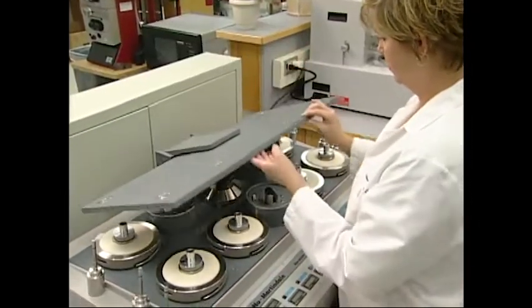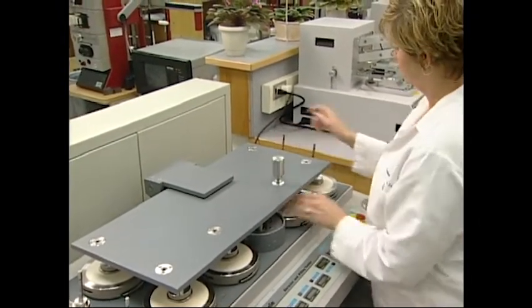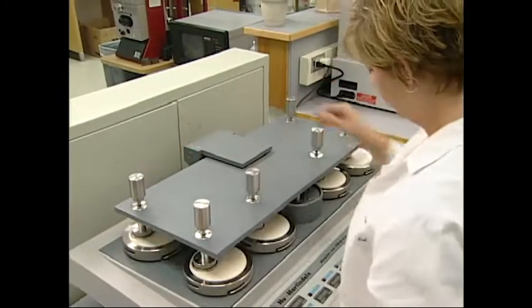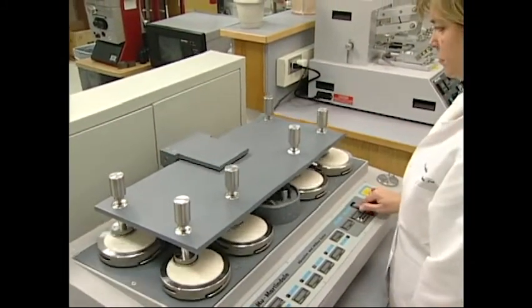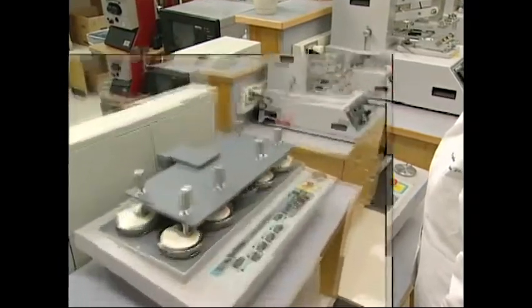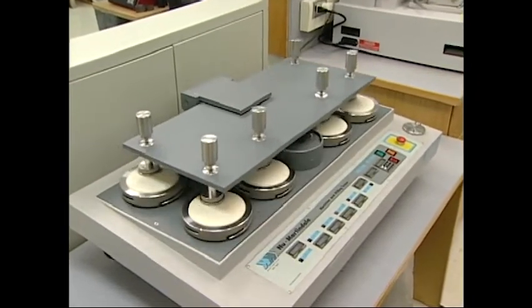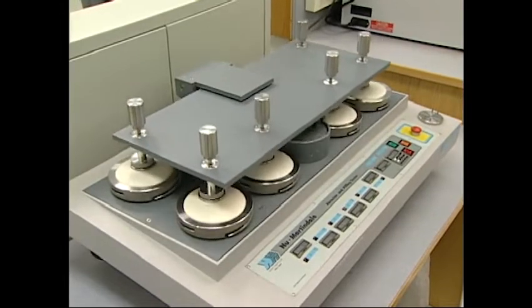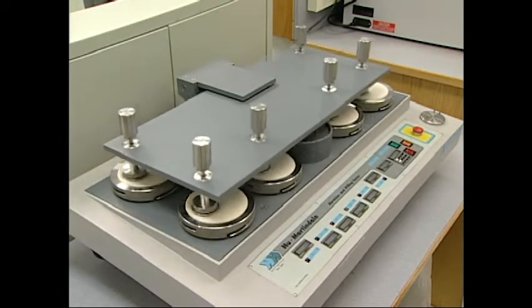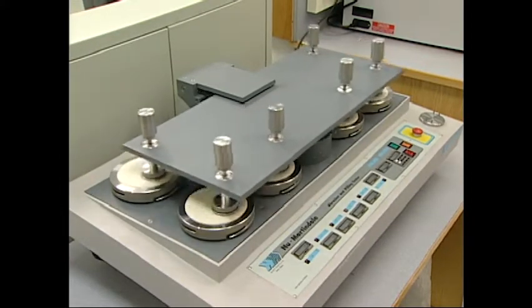The top of the tester is then lowered and the spindle is guided through the top plate. Once all specimens are loaded, the tester is started. Abrasion resistance using the Martindale tester is measured by subjecting the flat specimen to a rubbing motion. The direction of the abrasion is in the form of a geometric figure that begins as a straight line, which gradually becomes a widening ellipse, which eventually forms another straight line in the opposite direction and then traces the same figure again. The cycling of abrasion is performed for a specified number of times, such as 5,000.